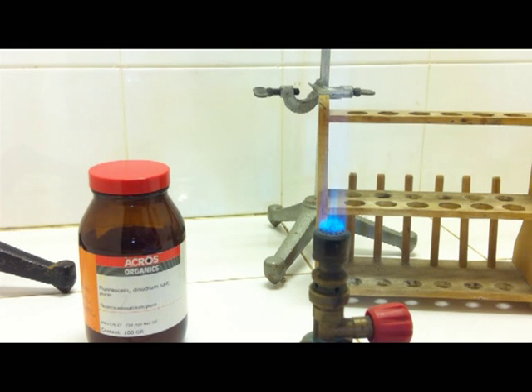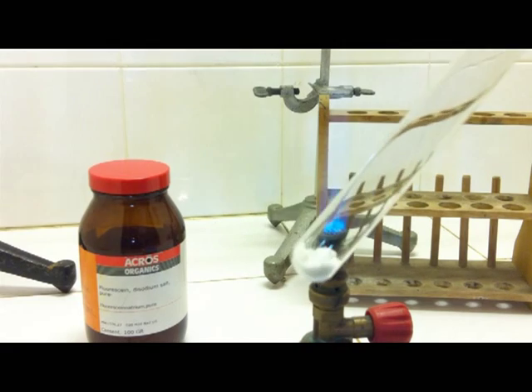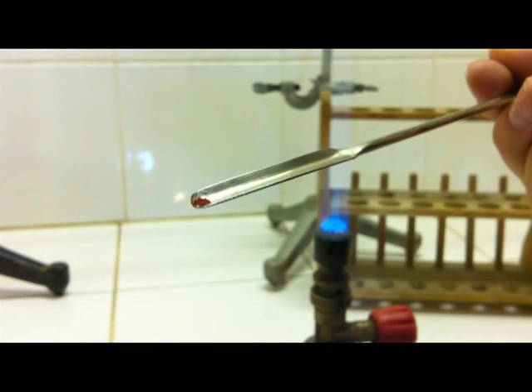But in this experiment, we use a crystal structure of tartaric acid and the sodium salt of fluorescein. This experiment is a bit empiric overall, so there is no need to take care of exact weights. The experiment works fine with about 1 or 2 grams of tartaric acid with a few crystals of uranine.